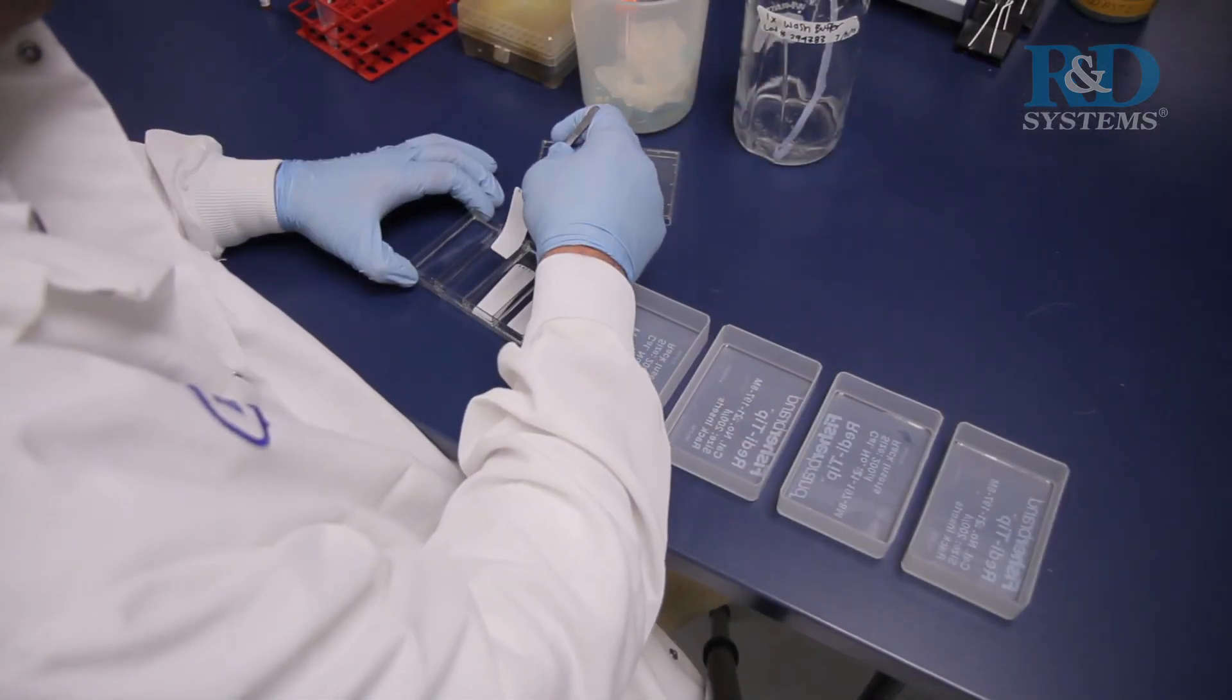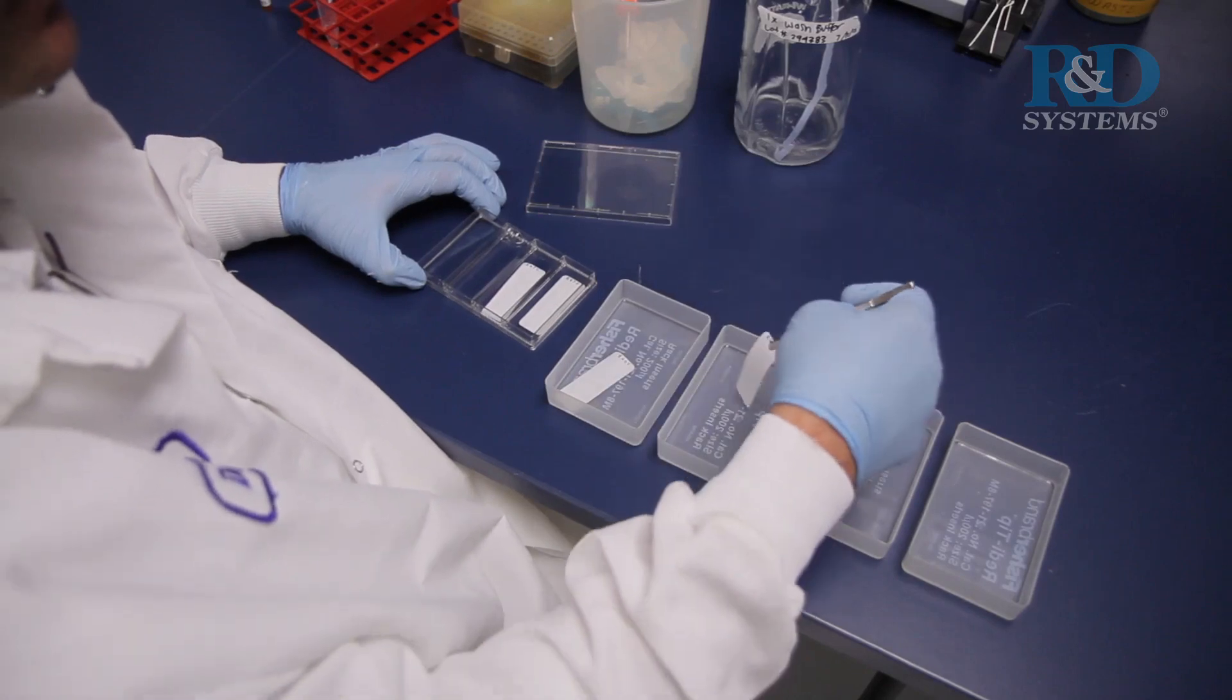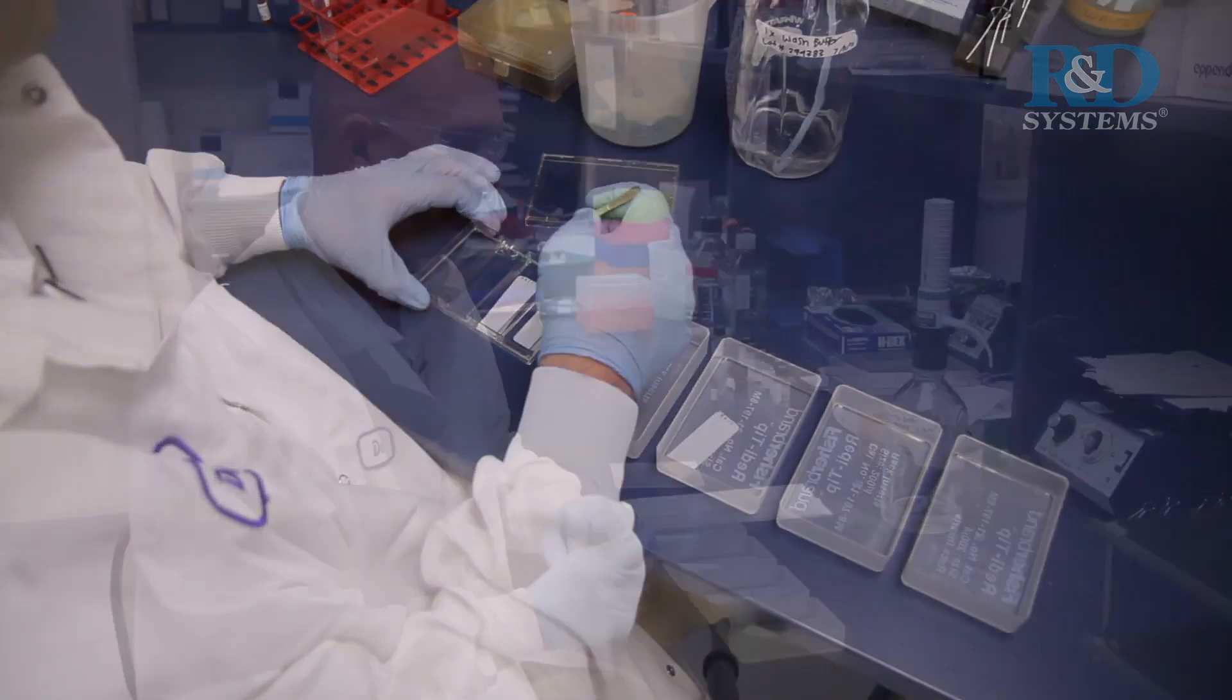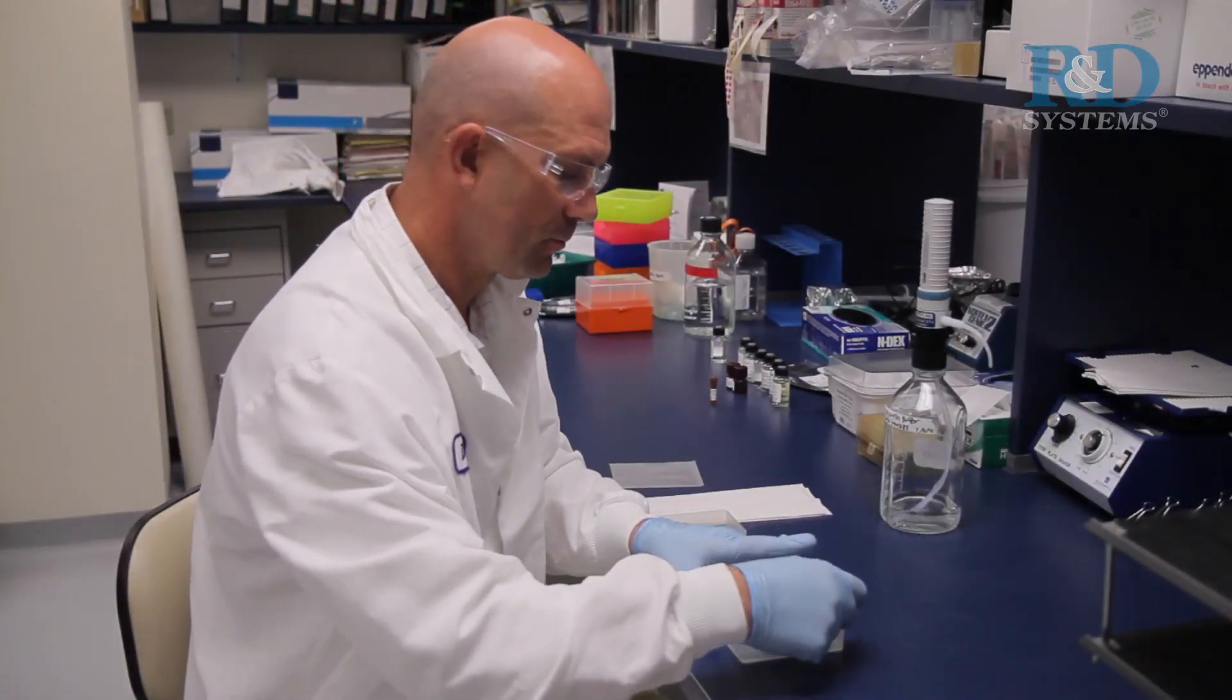Then, proceed to wash each array as described previously. Complete the remaining steps without interruption.